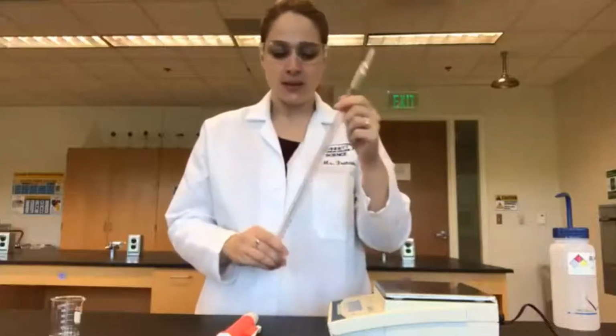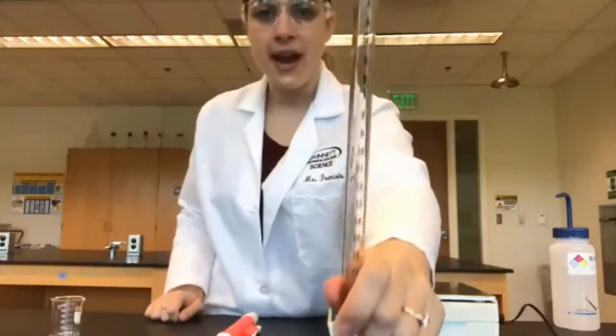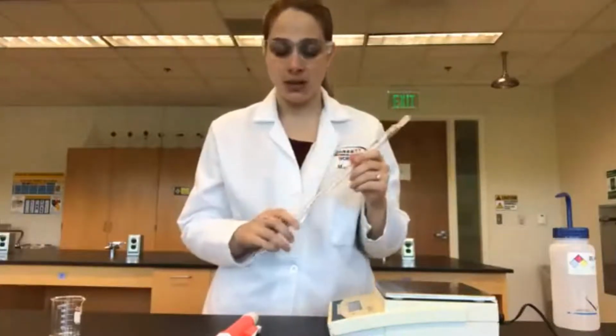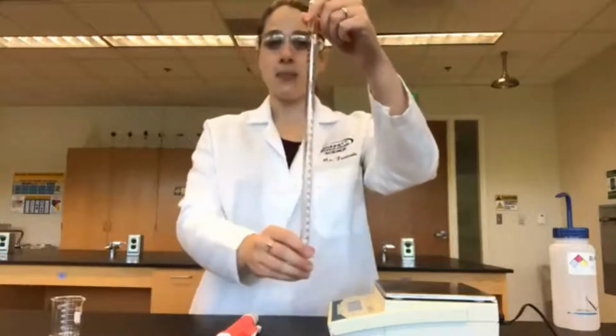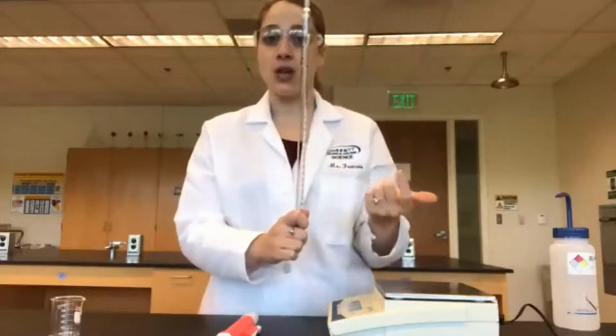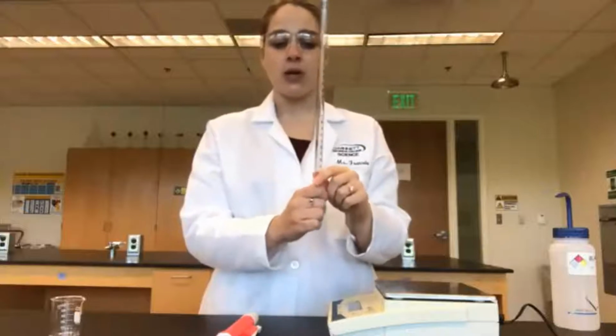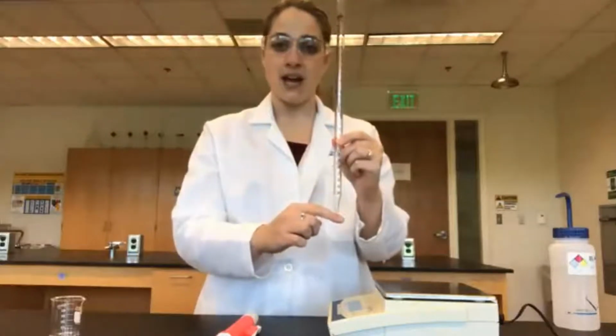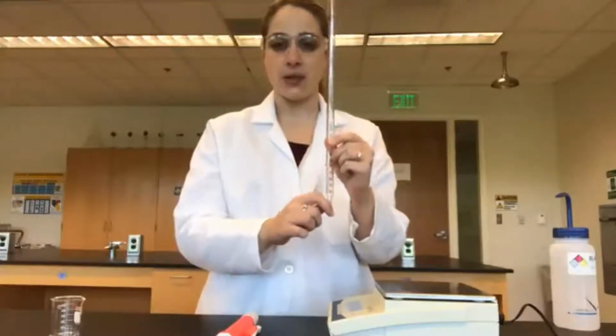Next up, we're going to look at the graduated pipette. Now we're going to look at our graduated pipette. This is a pipette, and you can see that it has the graduation lines on it. However, this is a 25 milliliter graduated pipette. We don't want 25 milliliters, we want 10 milliliters. So the way the graduated pipette works is kind of backwards, as you saw in the pre-lab video. So what we're going to do is fill up to the 15 line, because 15 down to 25 is 10 milliliters. So that's what we're going to do here.